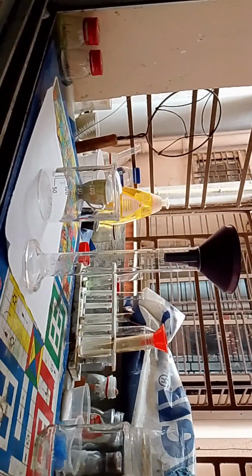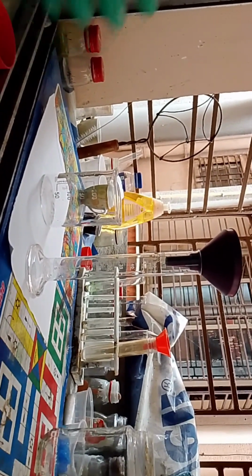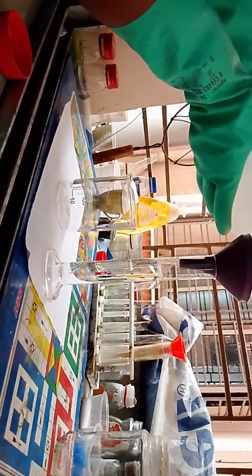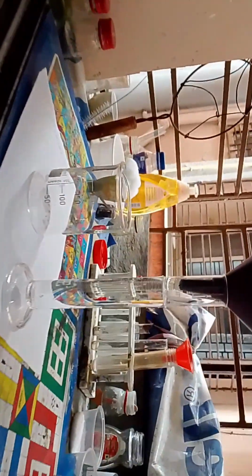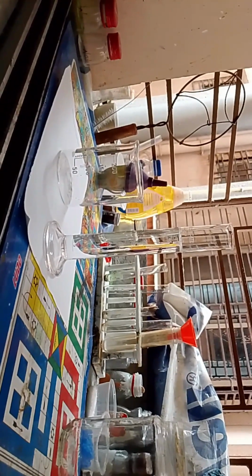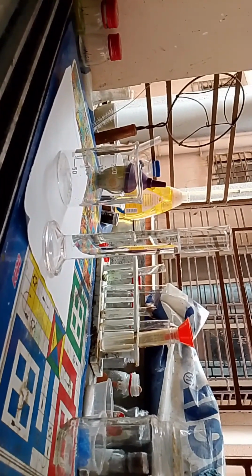Okay, so first thing we are gonna do is take 50 ml of distilled water, which you will see as the liquid falls, and we will touch the 50 ml mark. A little bit of water is left, I mean a little excess. Yeah, a little excess, but no problem, nothing will happen. Let's close the water bottle. We'll be using it again to dissolve another chemical.